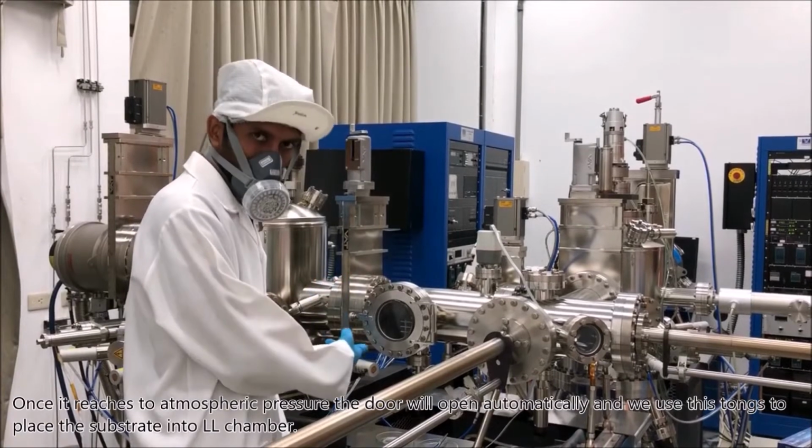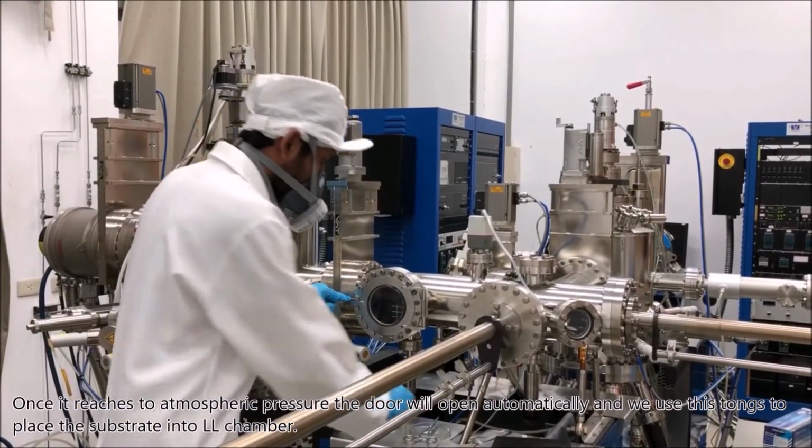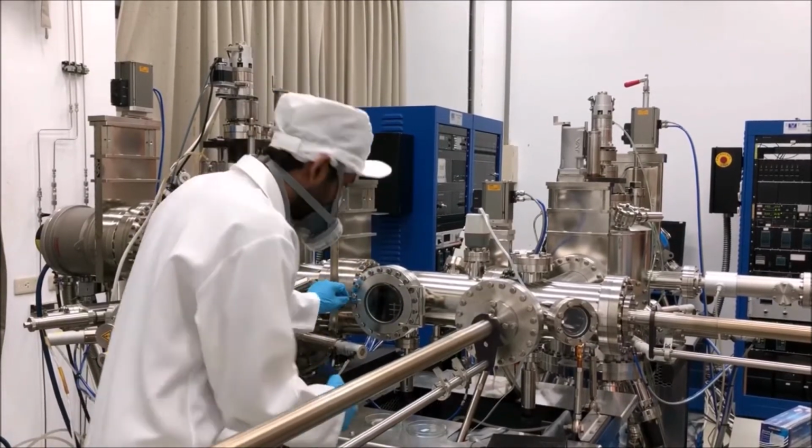Once it reaches atmospheric pressure, the door will open automatically, and we use these tongs to place the substrate into the LL chamber.